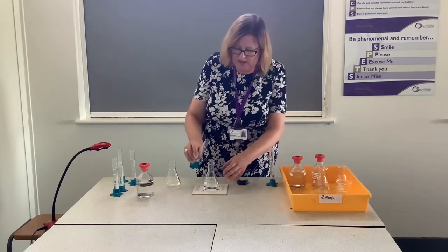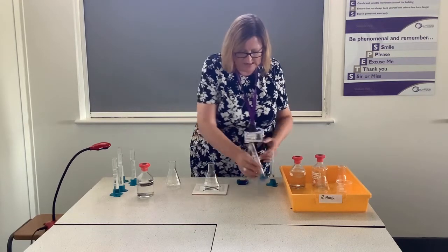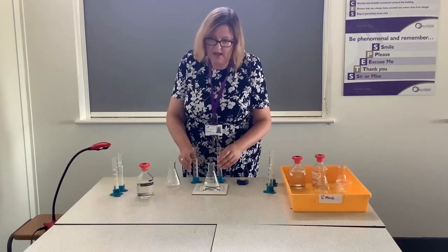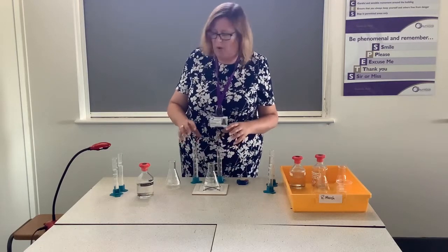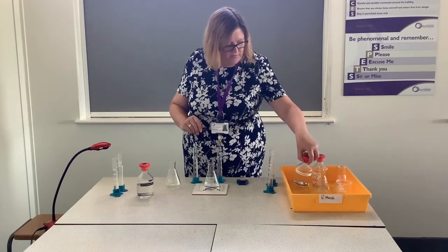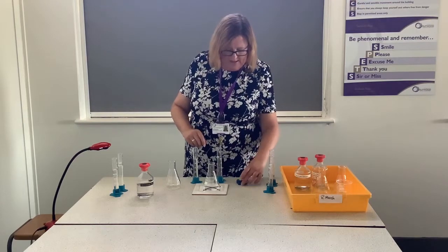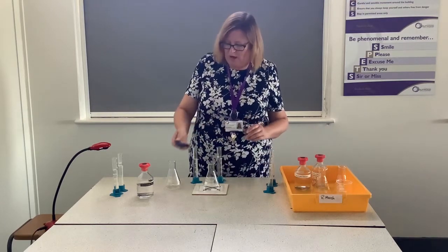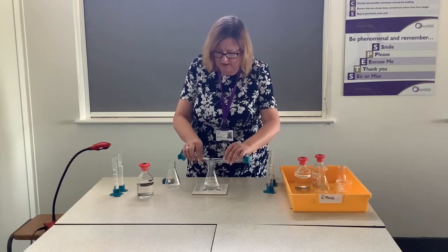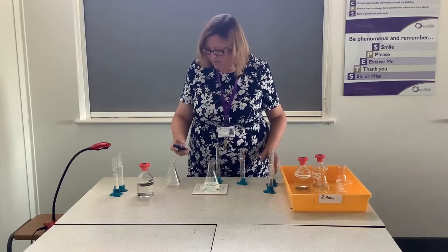I'm going to add 10 mils of hydrochloric acid to my conical flask over the cross — I can still see it clearly underneath. Then I'm going to add approximately 50 mils of the sodium thiosulfate. This first time, the sodium thiosulfate is 0.5 molar. It's useful to have a second person on hand, but I'm going to try and start my timer myself as well, as soon as these have gone into the conical flask.